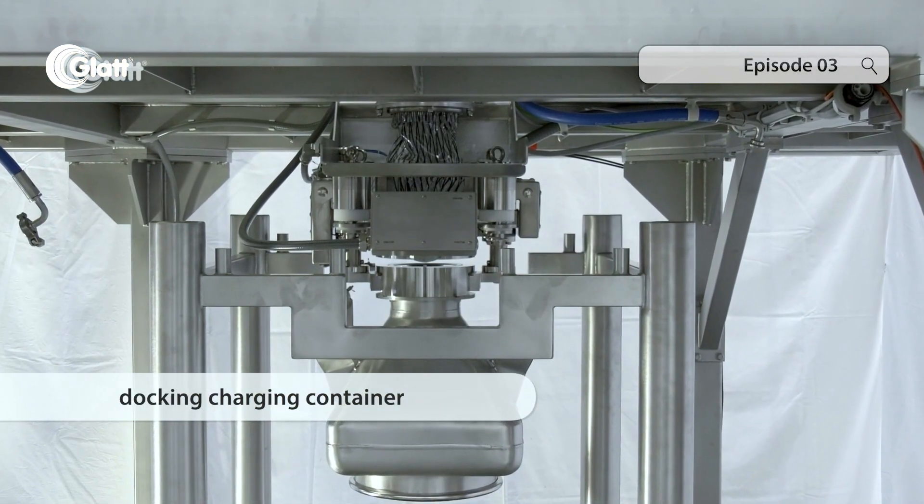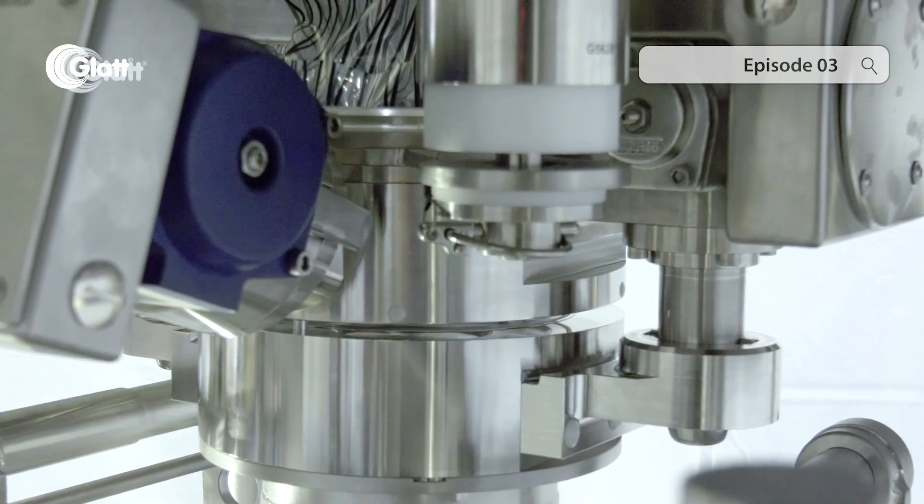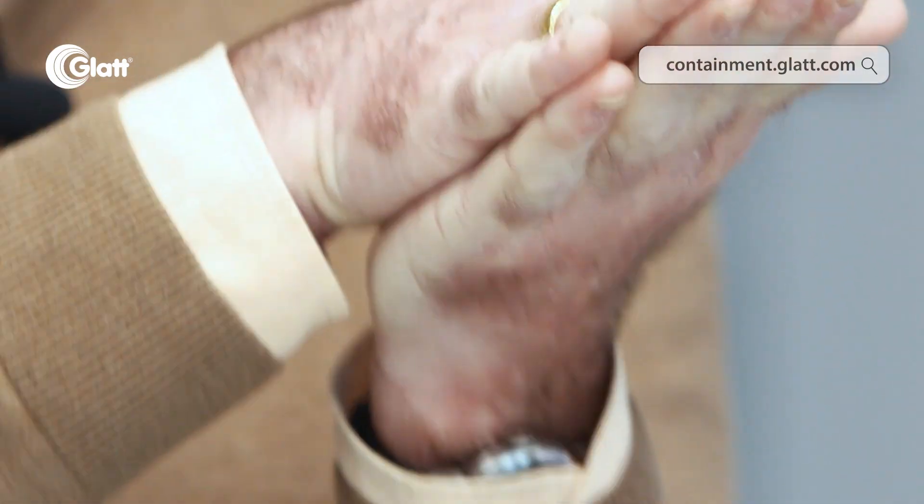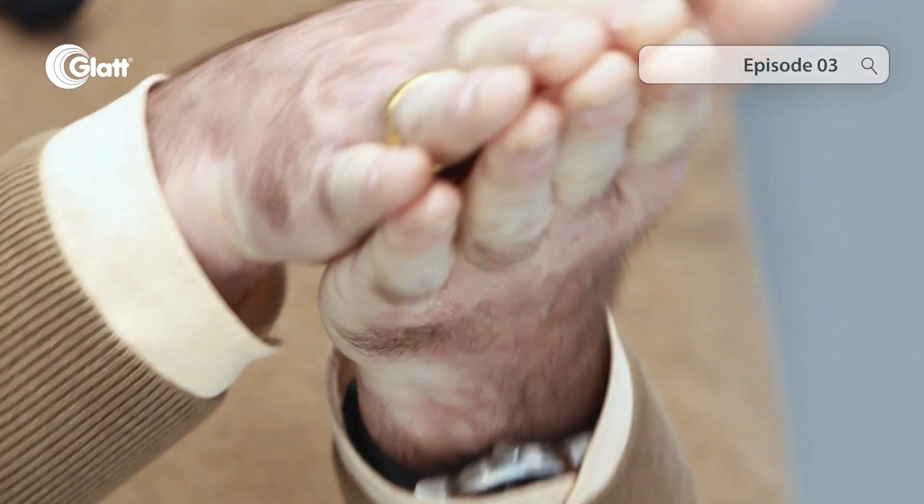Here we can see how the active half of the double flap is docked to the container at the isolator. On the container is the passive valve, which fits exactly like the palm of the hand to the other half of the isolator. Both halves of the flaps are docked together, locked together, and now they work as one flap.